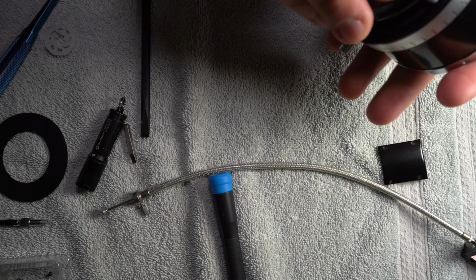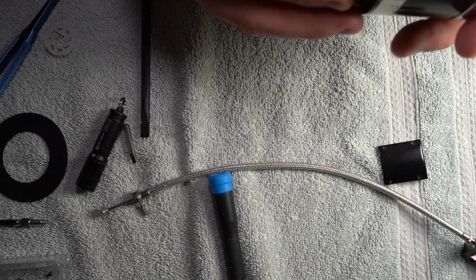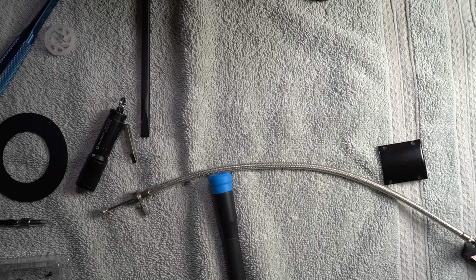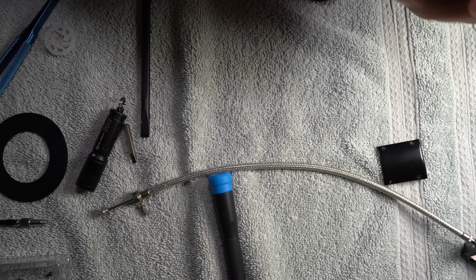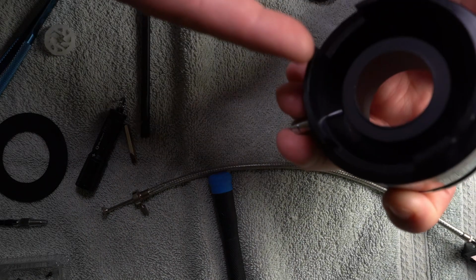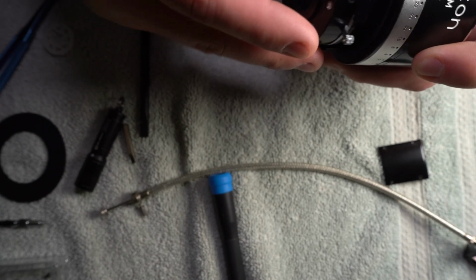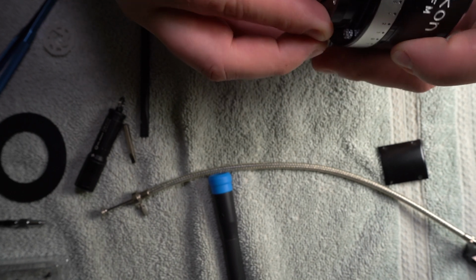So now this guy goes in here like that, and does it? Where does that go? Can't spin the whole thing? What does that do? Oh no, that does spin the whole thing. I'm an idiot. Okay. So this goes, there's a big pin in here and it fits in this hole. And so I put that over there, put that in there, and now it moves like it's supposed to.